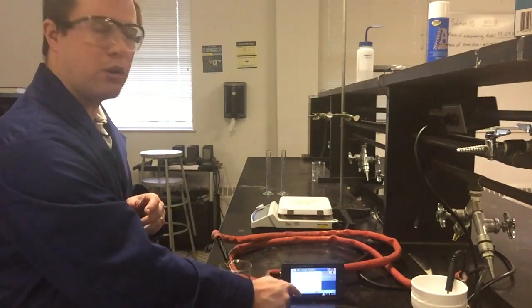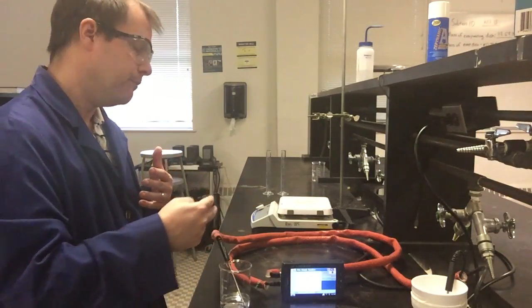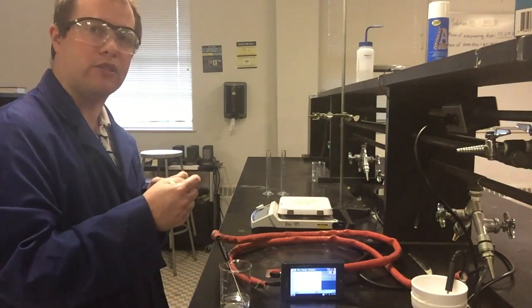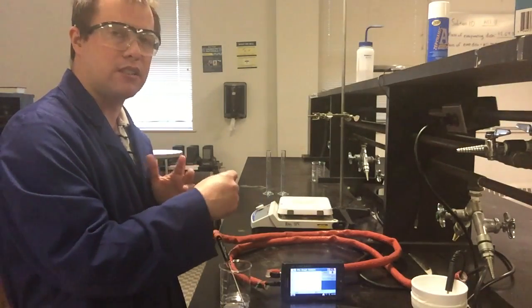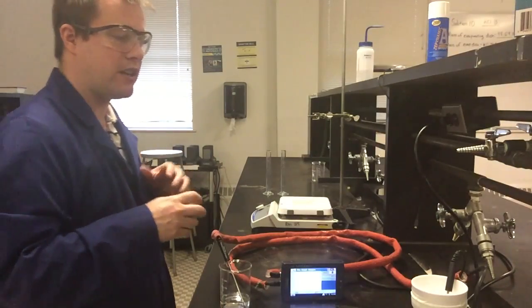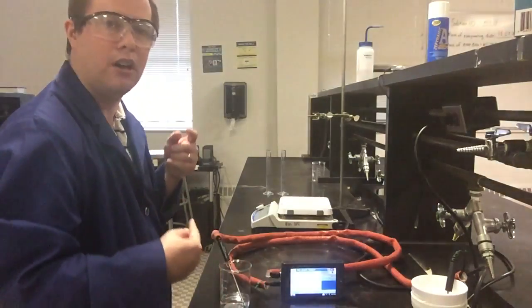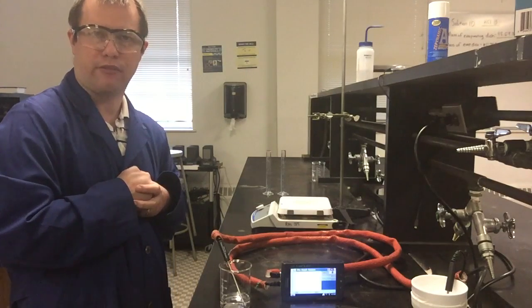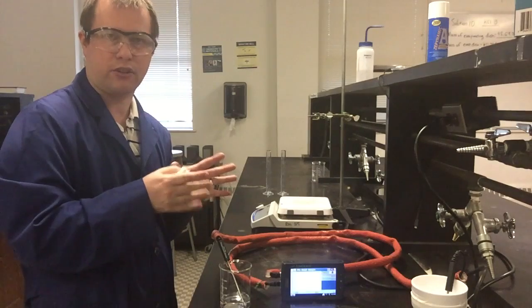I'm going to wait for this timer to get to 300 seconds. It's set to record for 600, which is 10 minutes. Because at 5 minutes, that 300-second mark, that's when we're going to mix our hot and cold water solutions together. Once they've been mixed, we're going to continue to record for 5 more minutes. We should see a nice plot of a high temperature and a low temperature that should come together. Then we can figure out what the final temperature of our solution is from looking at that information. I'm going to stop this rather than make you just sit here and watch this for another 3 or 4 minutes.